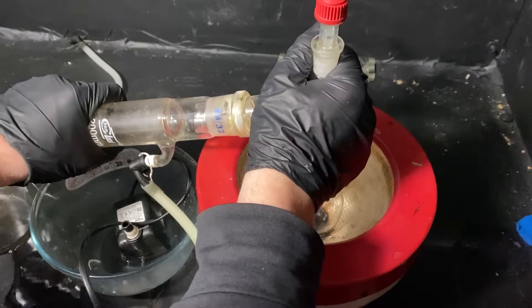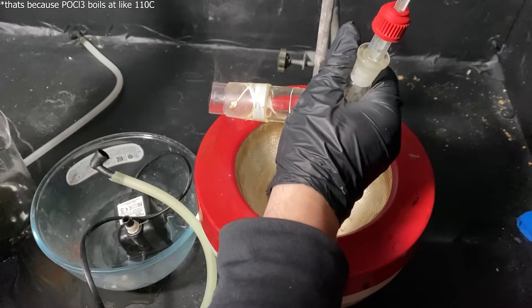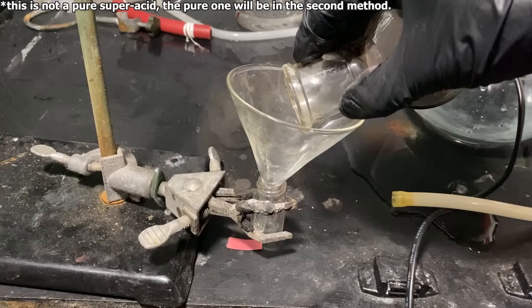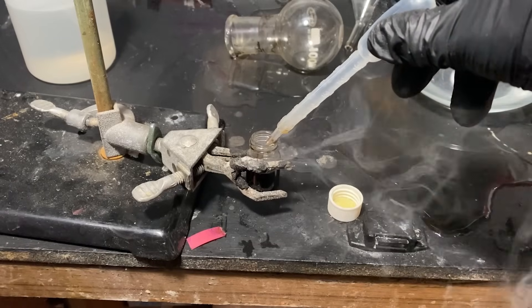Eventually, the thermometer in the flask reached 120°C, which means we've successfully separated the phosphoryl chloride from the mixture. Anyway, I've disassembled the apparatus and I've transferred the blackish superacid into a bottle. And totally no strange spillage happened here.